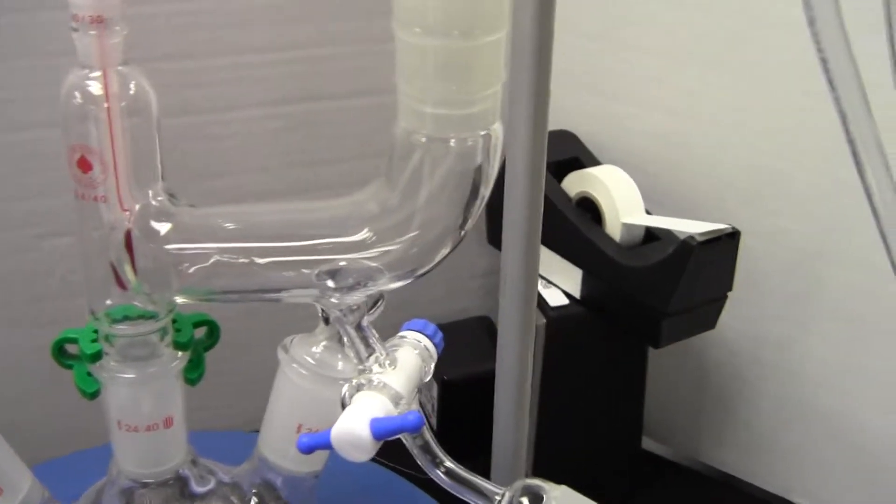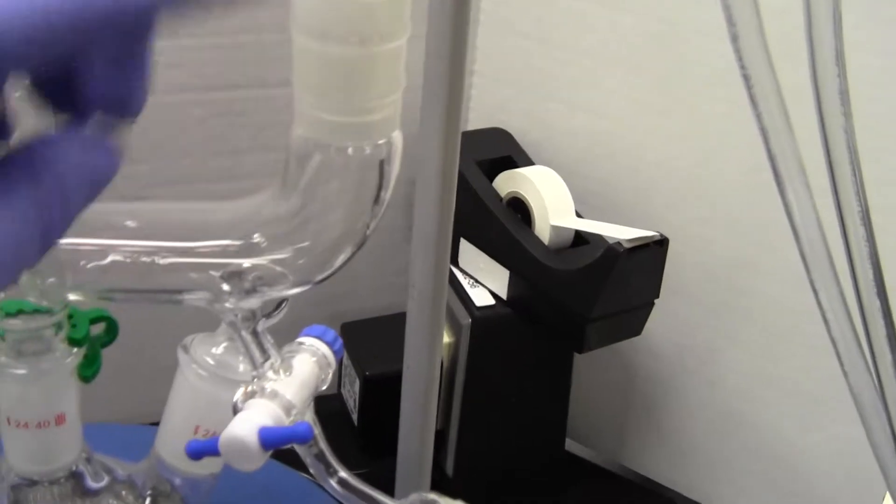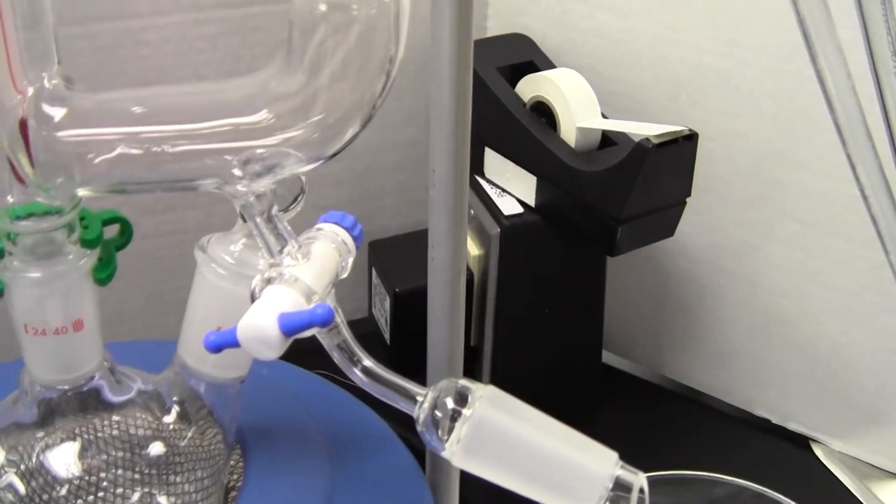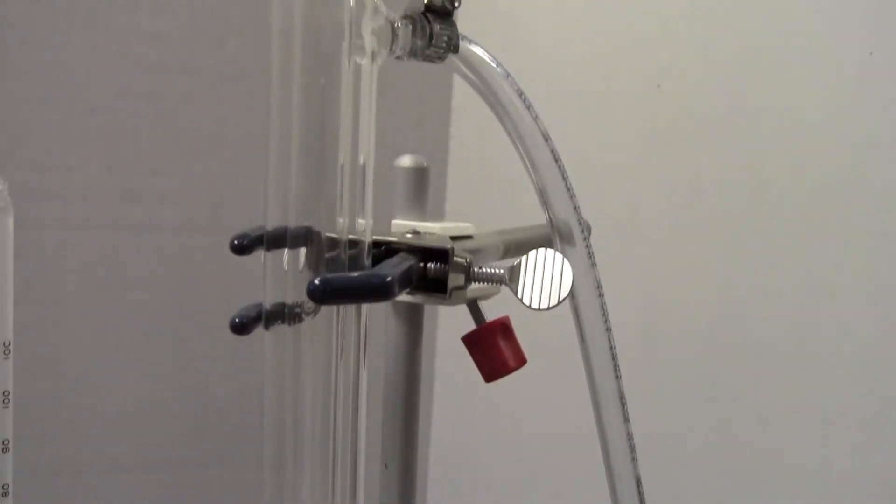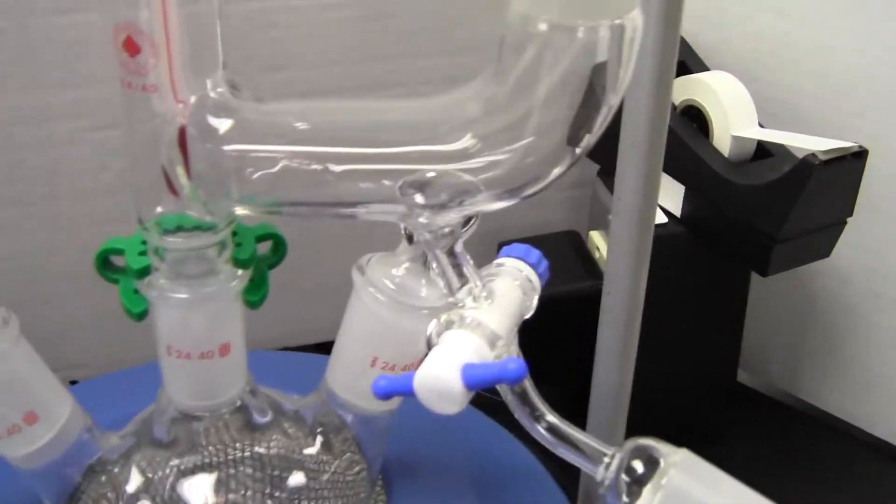A good reflux is not pouring down but a good fast drip rate. If the heat is on too high, the condenser is not very large, so there's a risk of exceeding the capacity of this system.